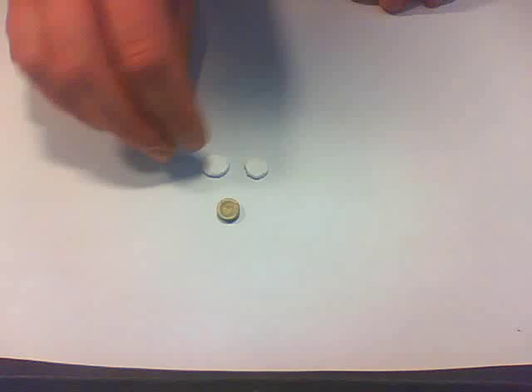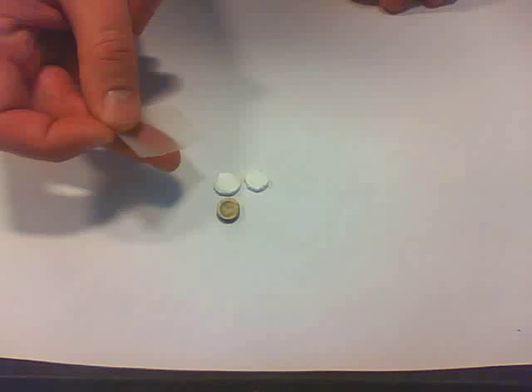I've made two small pieces of styrofoam that will be going on either side of this as a sandwich. I have a piece of parafilm. This may be hard to see due to the contrast, but that's just the parafilm. And then I have a PT100.